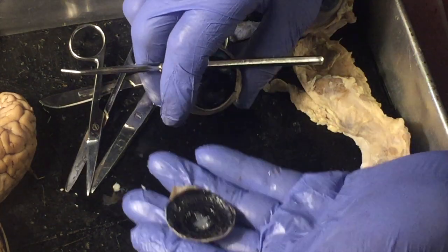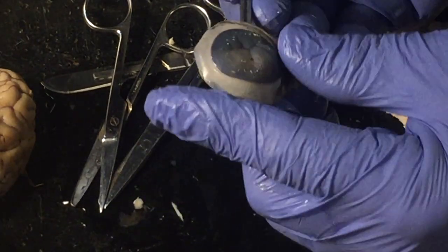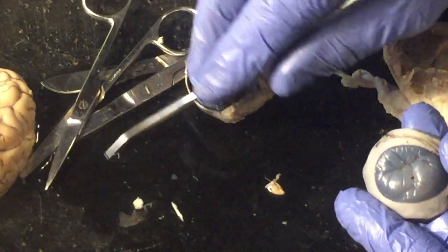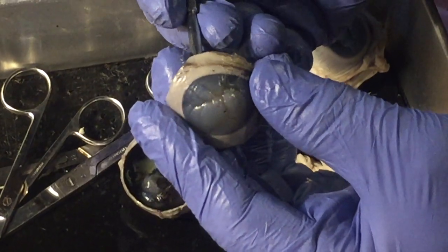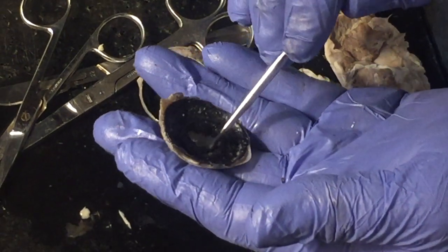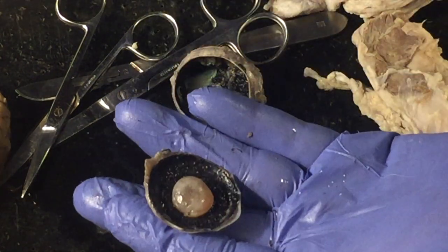Okay, so that's the front of the eyeball, and this cavity in front of the iris but behind the cornea would be filled with the stuff you see in the bottom of the tray here called aqueous humor. The amount of that in there would help dictate the size and shape of the eye. There are two chambers to the eye. The front chamber would be filled with aqueous humor, and it would be plugged by that lens.